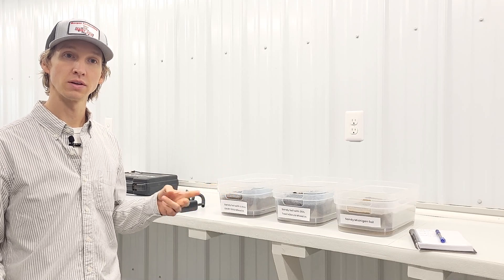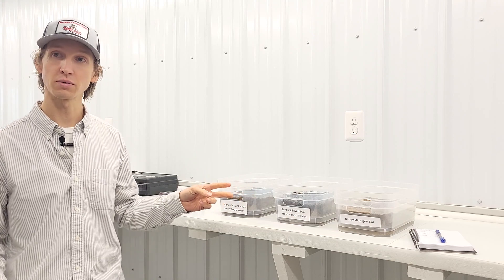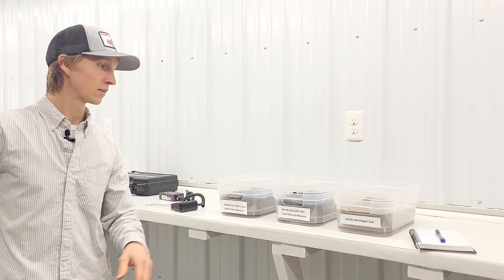It's been two days since we first added the water to these experiments. I'm now going to use the moisture meter and take three measurements in each of these trays and average them.